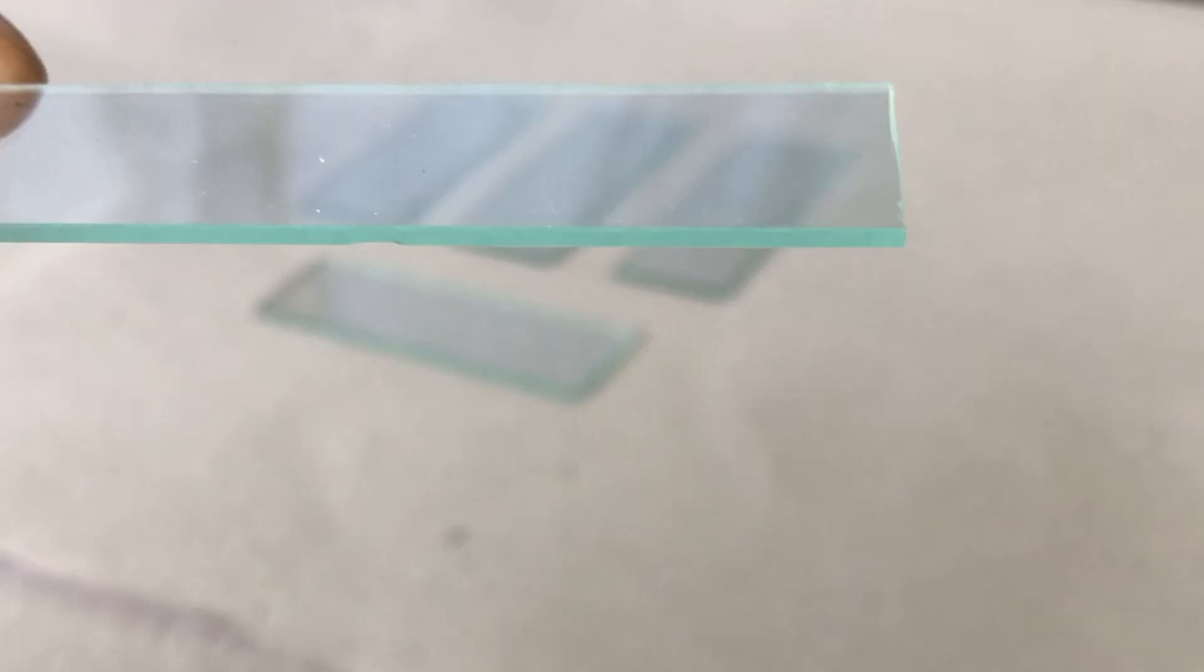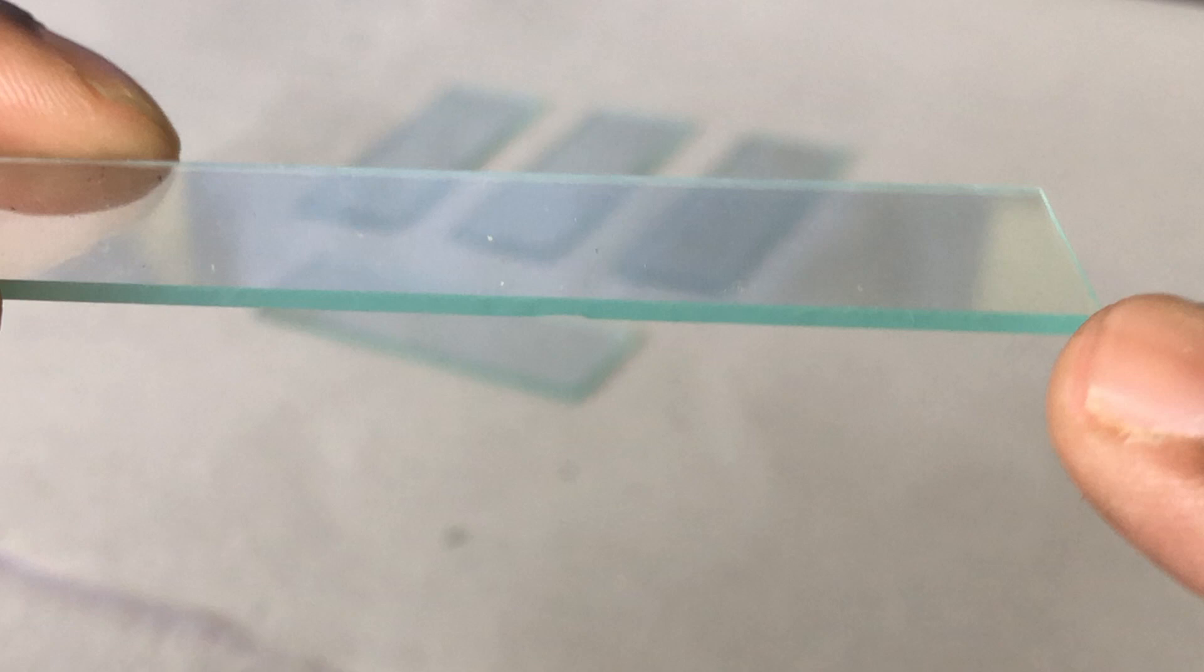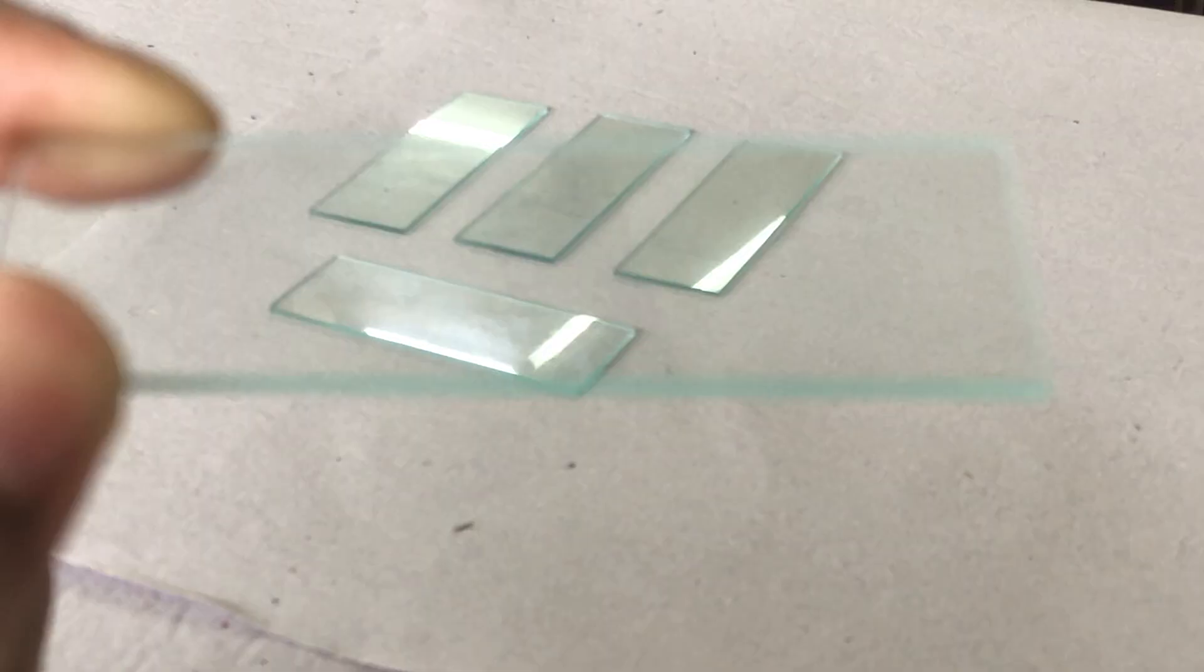Now any glass slide can be used for this purpose, but they should have sharp margins like this. A new glass slide can be used as a good spreader.